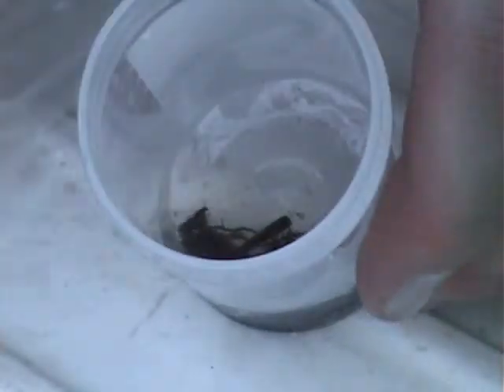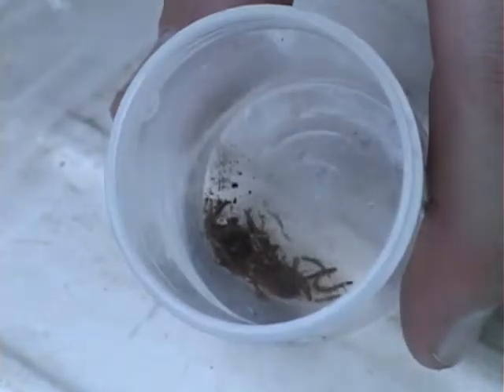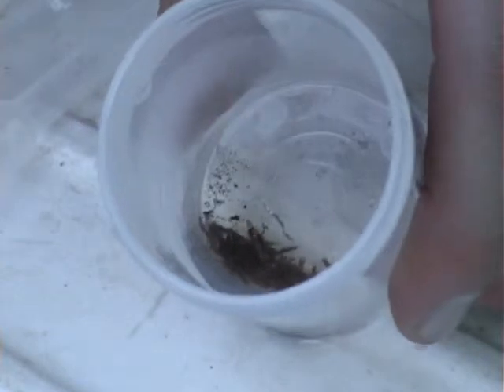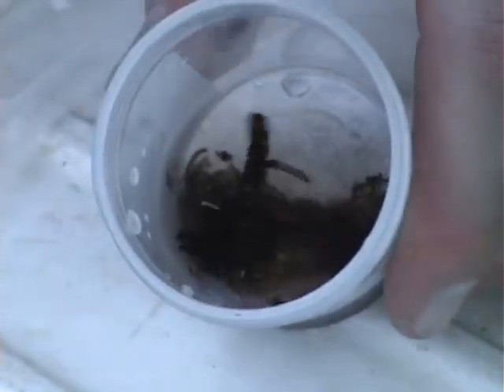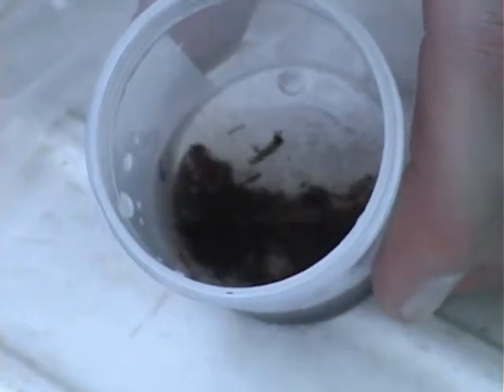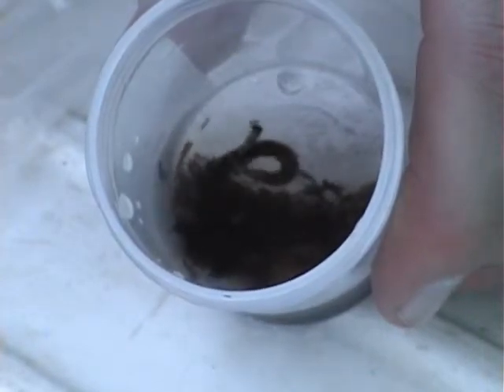The second thing I wanted to show you was how we've got these other hosts separated. We can see here the mayflies and trichopterans separated in one dish. The stoneflies found at this site seem to be possibly predacious, but they're just small enough that it's difficult to tell — so just in case, I've separated them in a separate container. And the third container has the mayflies and dipterans separated. What we'll do now is place these on ice and take them back to the lab for dissecting.